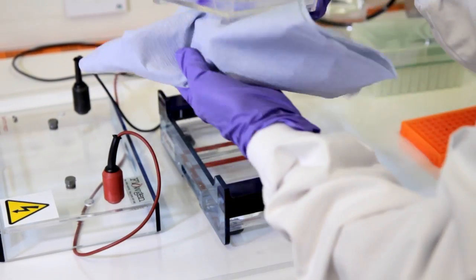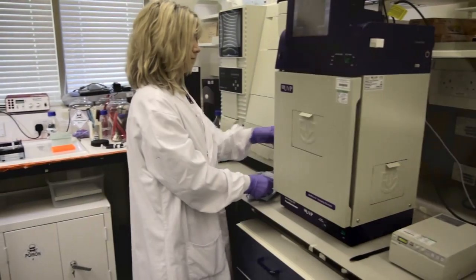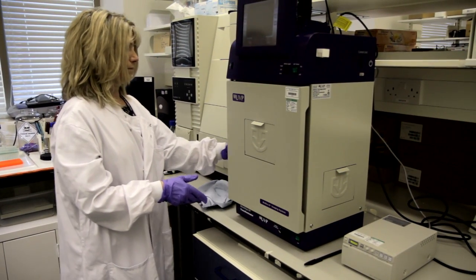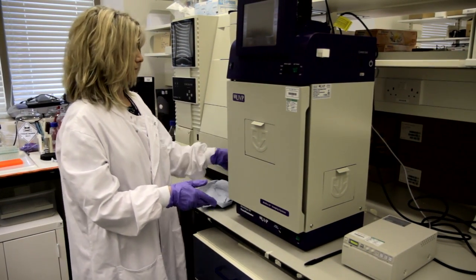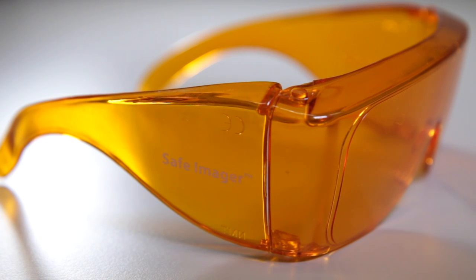To visualize your DNA, place the gel on an ultraviolet transilluminator, sometimes called an ultraviolet lightbox. This is used to see ethidium bromide stained DNA in gels. Remember, if no protection is available with the equipment, always wear protective eyewear when observing DNA on a transilluminator to prevent damage to the eyes from the UV light.